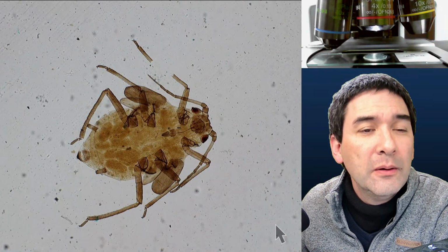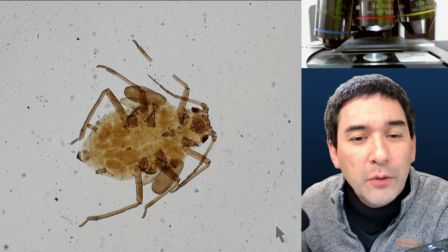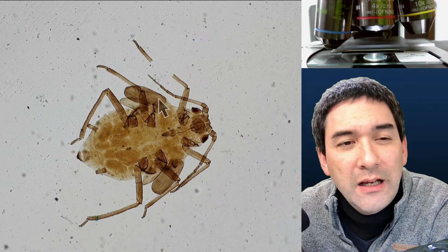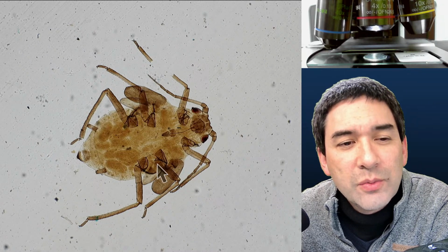Okay, here we go. You can always look at the top here, that is now the 4x objective. And I want to show you something over here. Do you see those little strange structures over here? This one over here, and this is the second one over here, right? And this one over here, and this one over here.